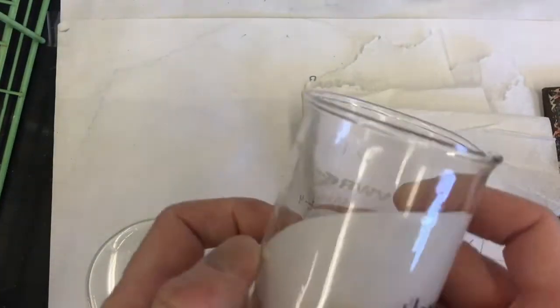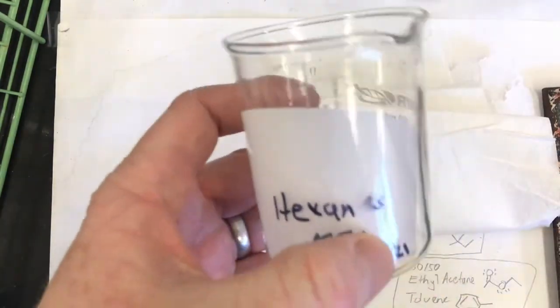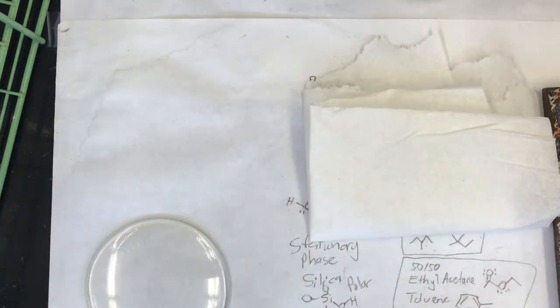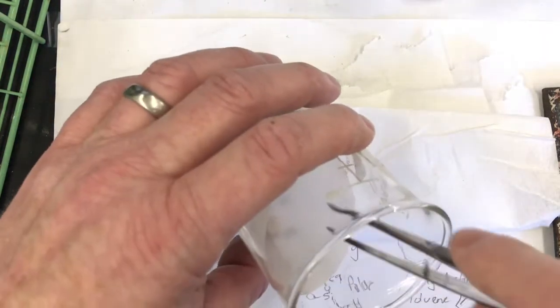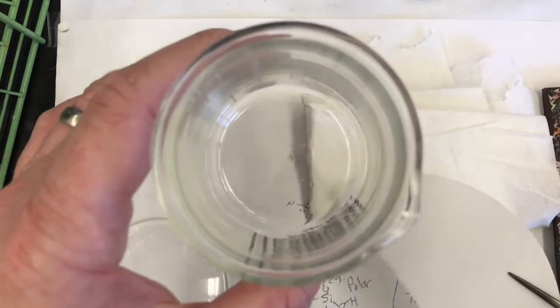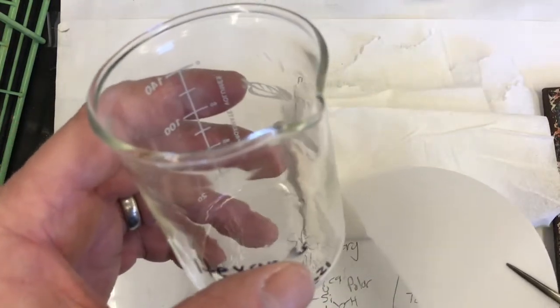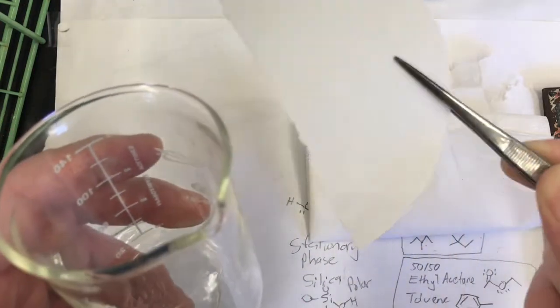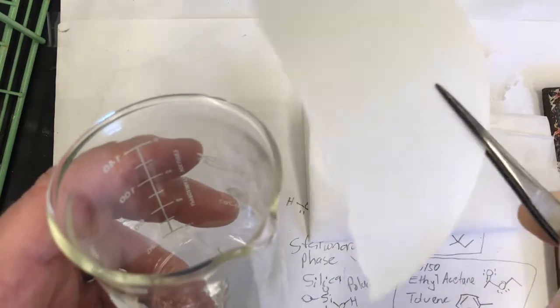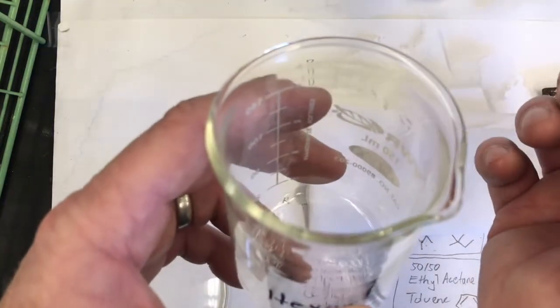I wanted to prepare one more solvent chamber. The hexanes didn't work, it wasn't polar enough. So what I'll do is I'll take the wick out of the hexanes chamber. And actually the hexanes that was in here, I poured it into our waste bottle in the fume hood over there. And now this wick, I'll just kind of shake it around to dry it out, and I'll reuse it for the next solvent chamber. So I'm gonna set it over here, and the hexanes will evaporate pretty quickly all on their own.